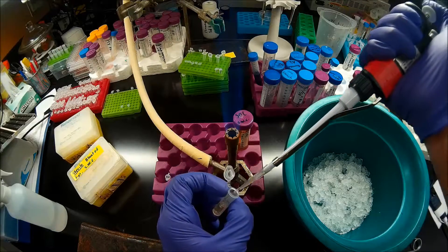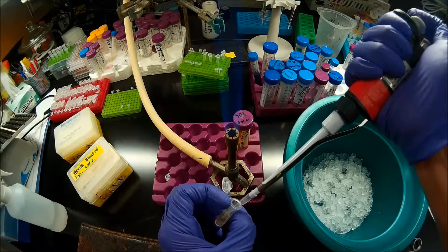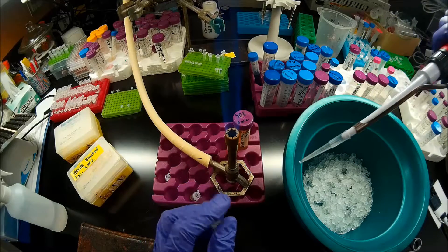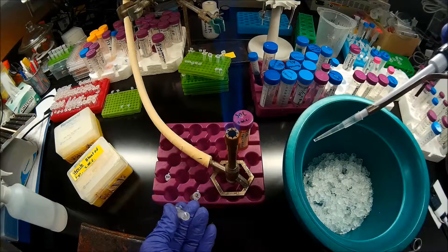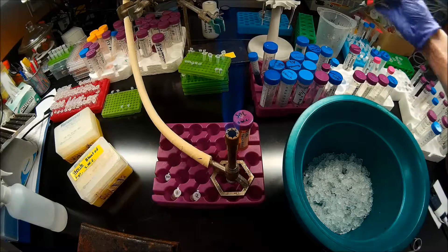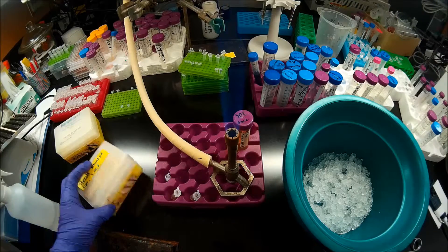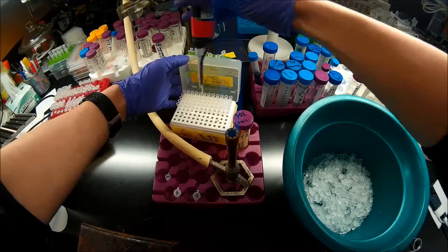That's not entirely necessary. You can get away with using non-blunted pipette tips, but you'll want to try to pipette more slowly if you're doing that, whereas you can work a little bit faster if you're using blunted tips.